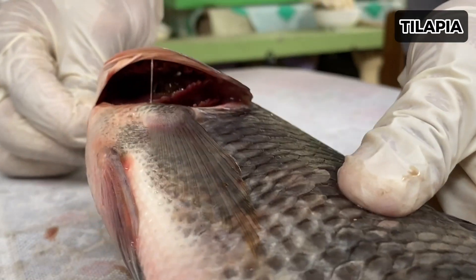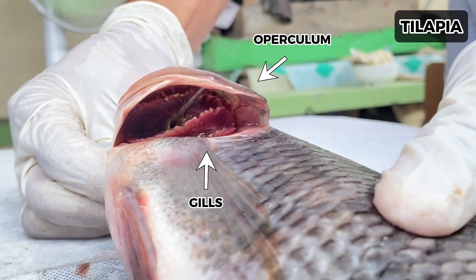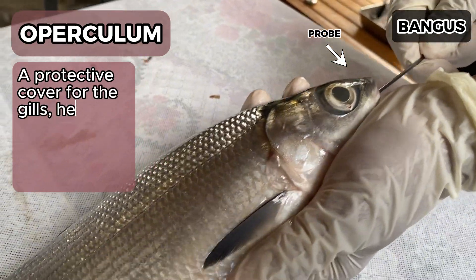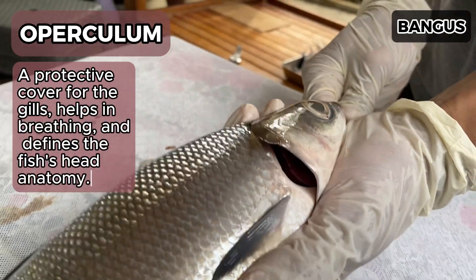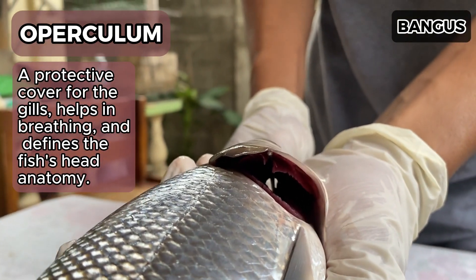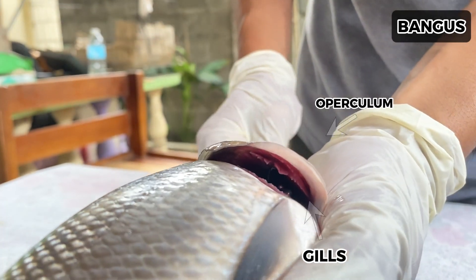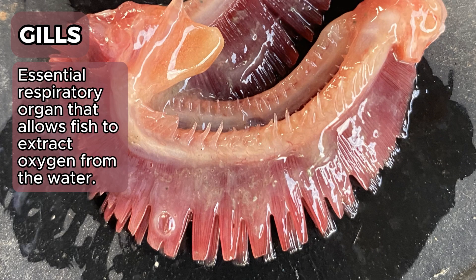Next, we will take a probe and insert it into the mouth of the fish, gently pushing it in and through the operculum, which acts as a protective cover for the gills, helps in breathing, and also defines the fish's head anatomy. Through this, we will be able to see the gills, which are the essential respiratory organs that allow fish to extract oxygen from the water.